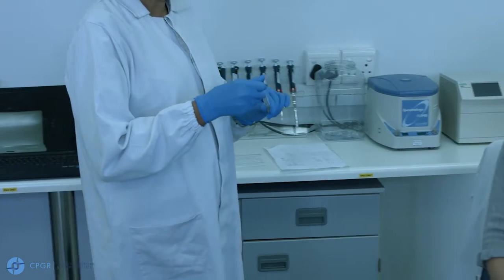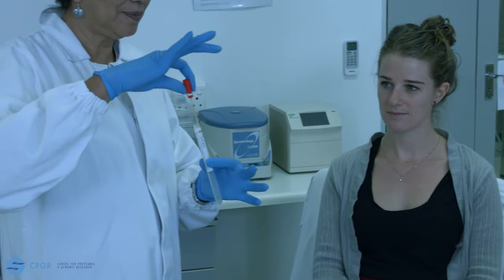Carefully open the buccal collection tube and remove the swab, taking care not to touch the swab.